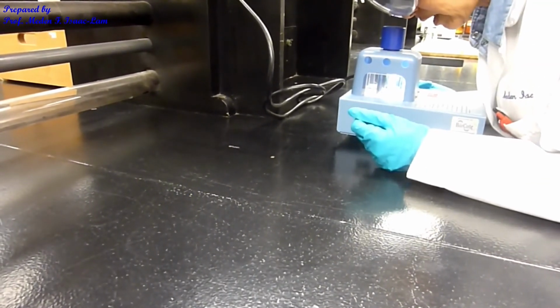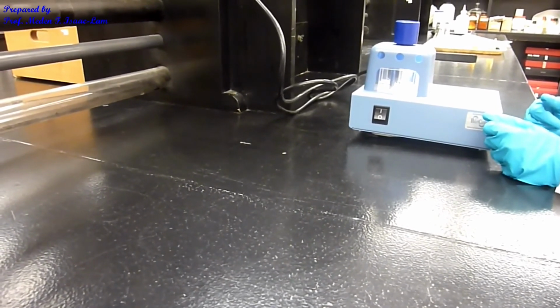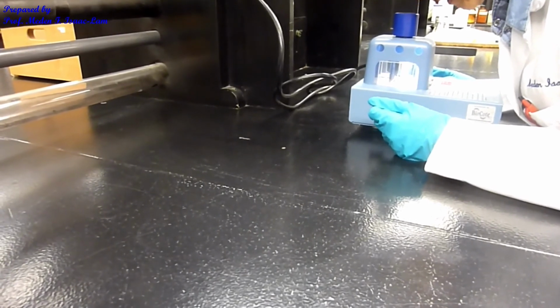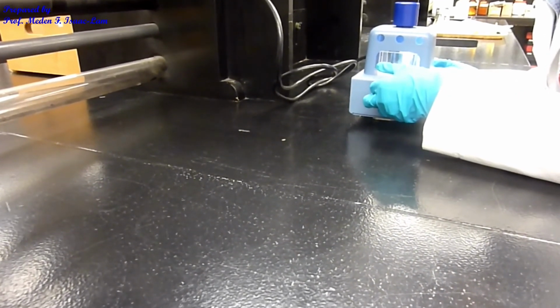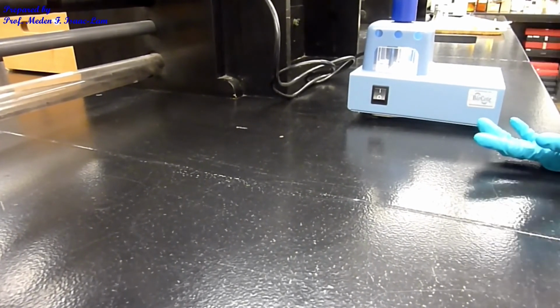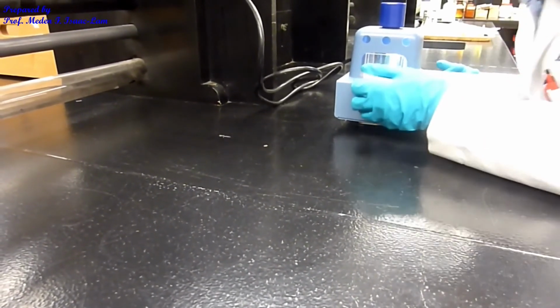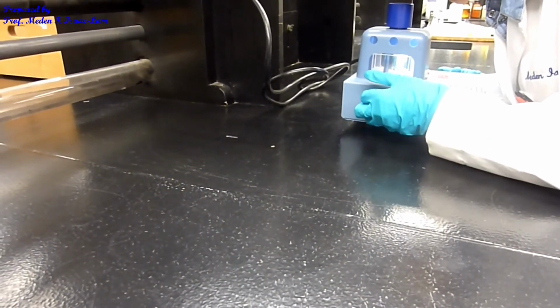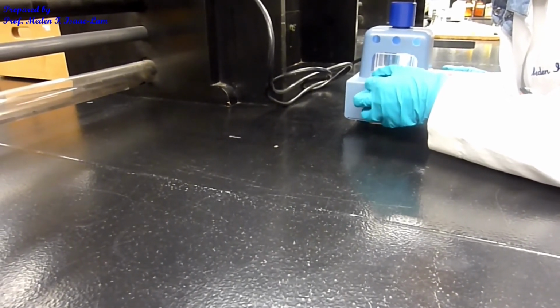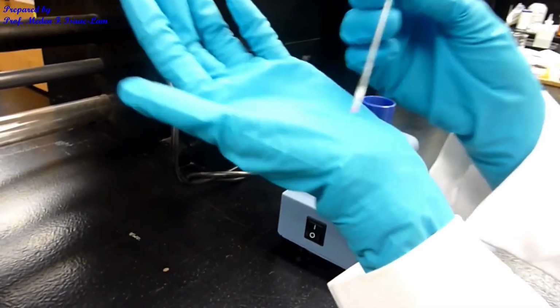Actually, the melting point was about 123 to 124, and then I'm going to take out the sample, because you can see that the top one became pink. So I'm going to pull it out. It will immediately become a solid, because the room temperature is lower than the heating block. So if I take out the top one, you can see that it's actually pink.